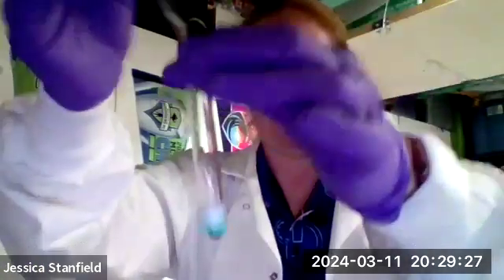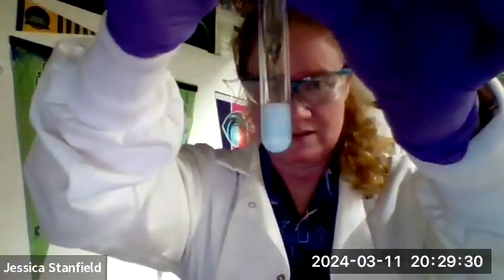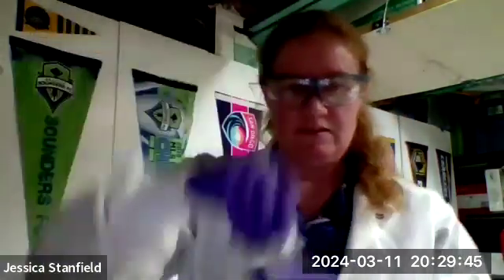There, do you see that? That white solid, that is the silver chloride. Okay, so we formed some silver chloride there. This is a double displacement reaction. We can do a few more of those. Let's see here. I'm going to take some sodium hydroxide and put that into a test tube.